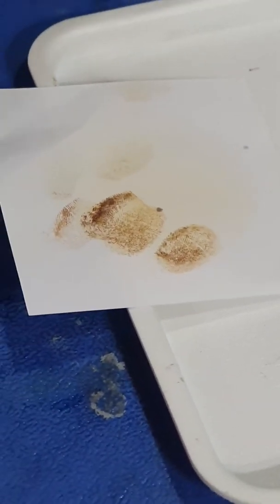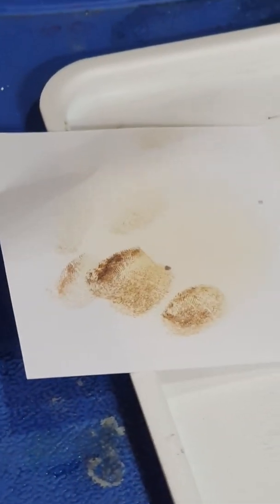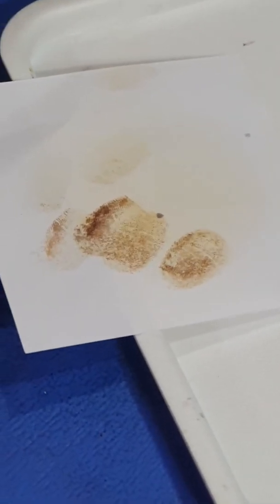These are really clearly visible! Stay away from the fumes — really visible. If you want to see it, just bring it a bit closer to the camera.